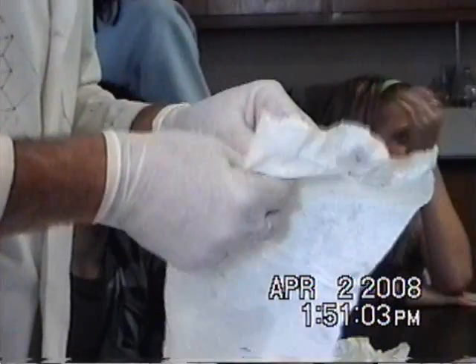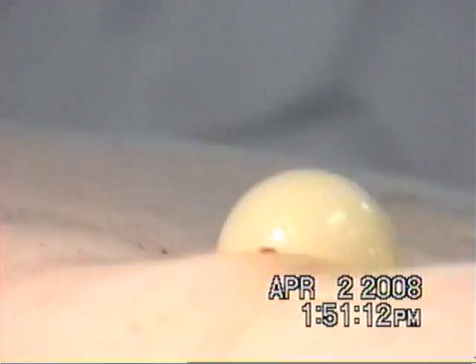Here's the most interesting part of the eye — it is the lens. It is very round. That's the lens of the shark's eye. And it bounces.